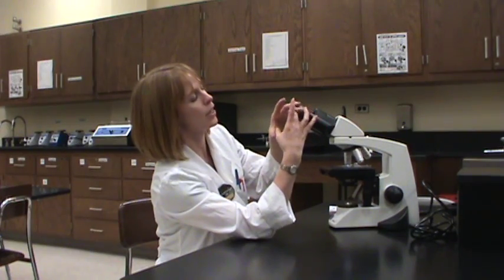At 10x, because I'm looking at a bacterium, I still can't see much of anything — bacteria are very, very small — but I can see that something is there. So I'm going to look through the ocular lens and find an interesting spot on the slide and position it into the center of the field of view. The field of view is what you see when you look through the ocular lenses. The reason I do this is because as I zoom in and magnify more and more, the field of view gets smaller. So if I'm originally looking at something way over here in the corner and I zoom in, it's no longer going to be in the field of view. By putting it in the center, I'm ensuring that when I go up in magnification, it will stay relatively centered.